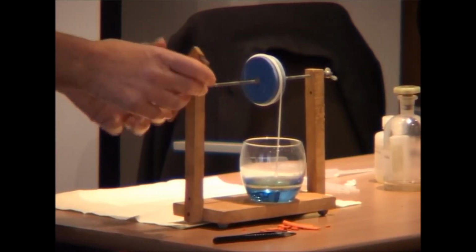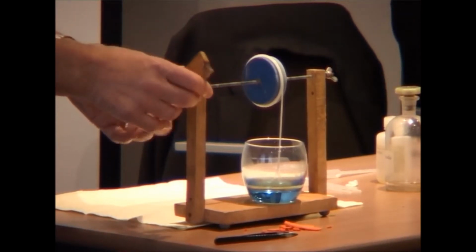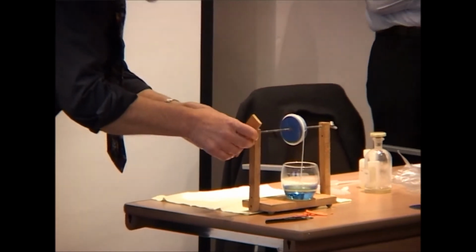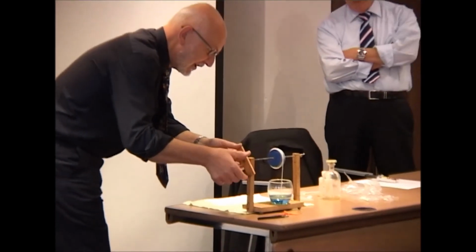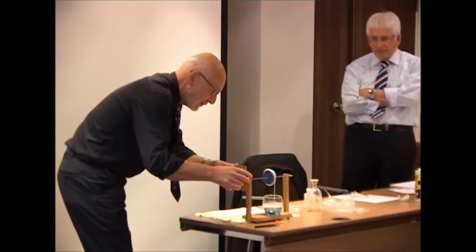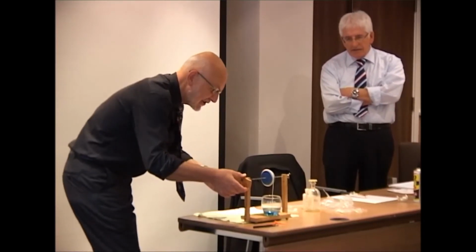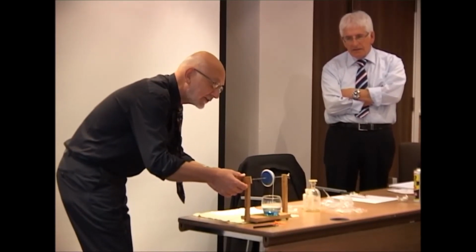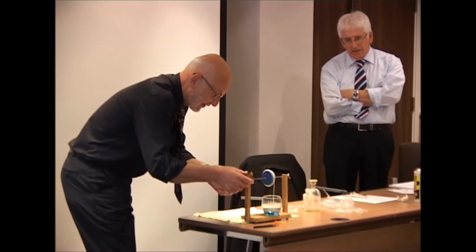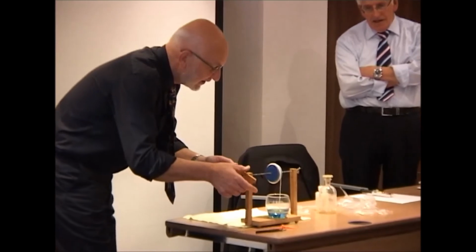On we go. Now this reaction is going on at room temperature. It's between an acid chloride and an amine rather than a diacid and a diamine. So it takes place very readily for that reason. Also, we're getting some additional assistance from the diamine because some of the diamine is actually being wasted in a sense, and it's soaking up the hydrochloric acid which has been given off in this condensation process. That's removing it from the scene of the crime and enabling us better to form this polyamide.